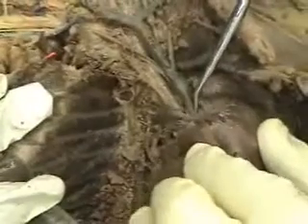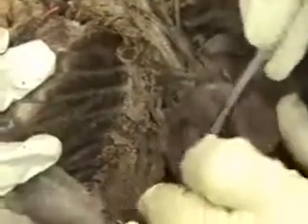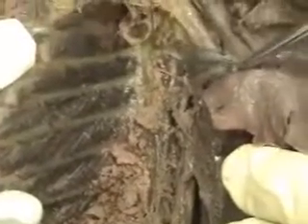Now, in terms of the veins, and this is not too clear right here, it's been somewhat broken, but we would talk about a brachial vein, an axillary vein, and over here the subclavian vein, in that order. That's a brief review of the veins. And just a couple of other things, following the superior vena cava, there is a vein right here on the side called the azygos vein that connects up with the superior vena cava. This comes up along the vertebral column, not too well injected, but this is an alternate pathway for the blood from the lower part of the body to get back up to the heart. Of course, the major pathway for the blood from the lower part of the body to get to the heart is the inferior vena cava.